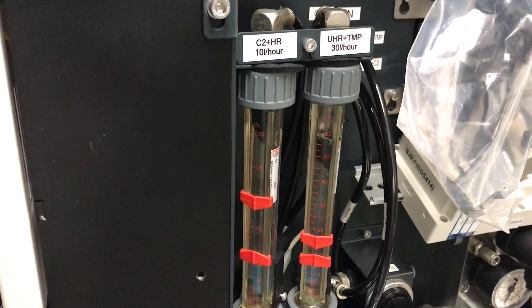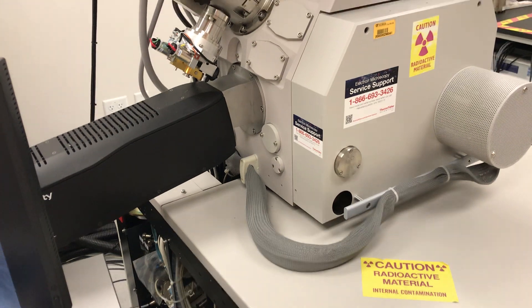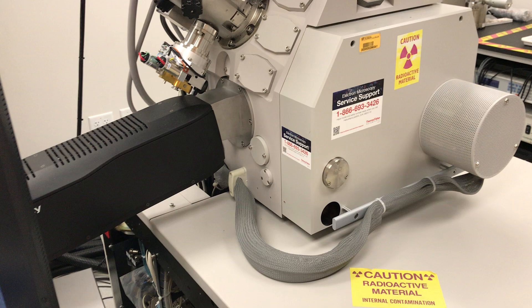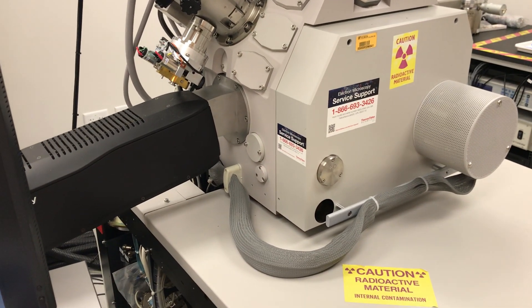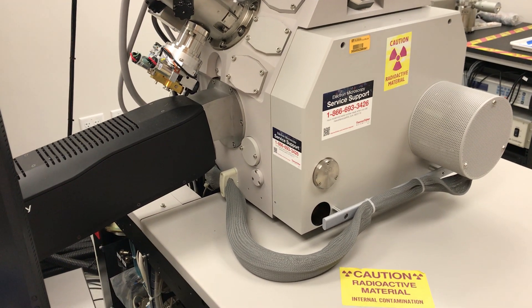I've looked at the image and can verify that there isn't any instability, which is obviously what you'd need to confirm. There's also a time component to this — if you make an adjustment to the flow, the change in chiller temperature is not going to happen immediately. This was something that over really a few days I had to tweak until I got the flow set just right at the microscope so that the chiller was hitting the set point.